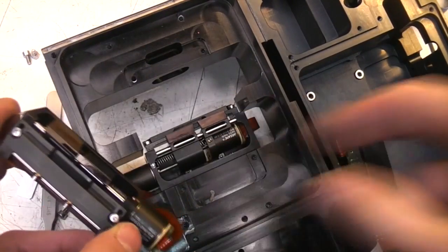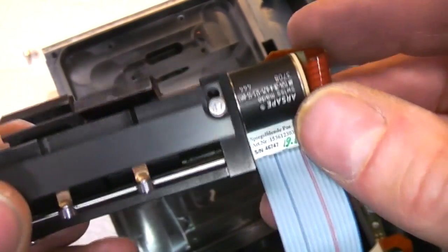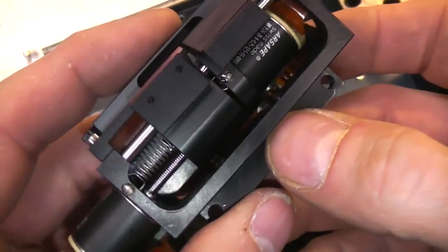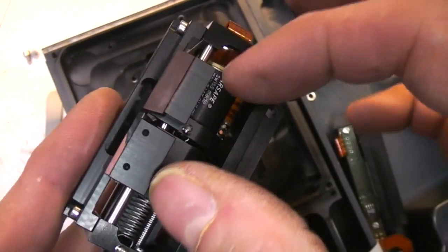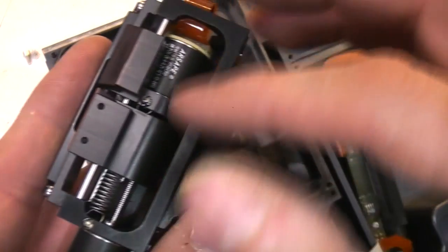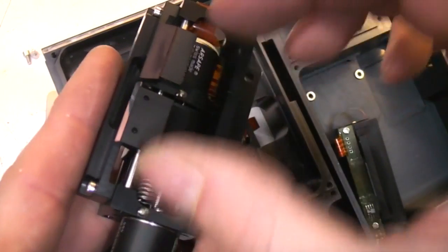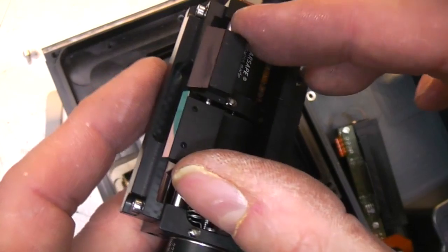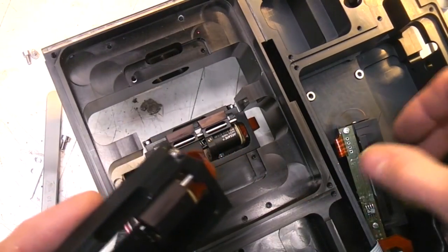And down here in the detector we've actually got 3 motorized slit assemblies. So we've got 2 tiny little motors, and I think the way this works is one of them moves the whole assembly backwards and forwards, because this second motor looks like it's actually mounted on a moving assembly, and then the second motor adjusts the slit width. So this basically sets the wavelength, and then the slit effectively adjusts the spectral resolution. I'm assuming there's one of these for each of the photomultipliers.